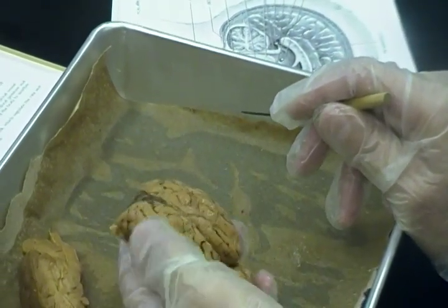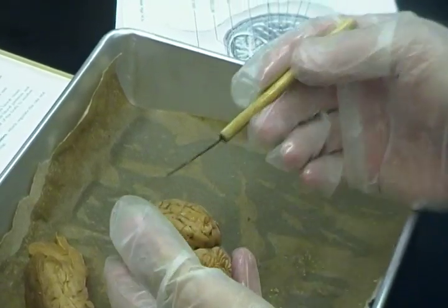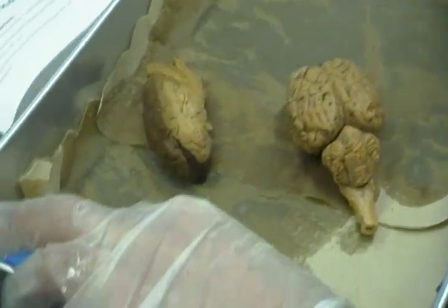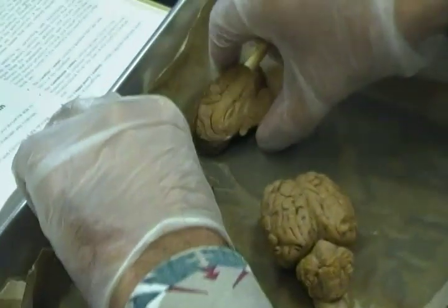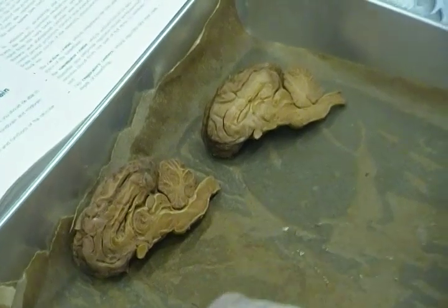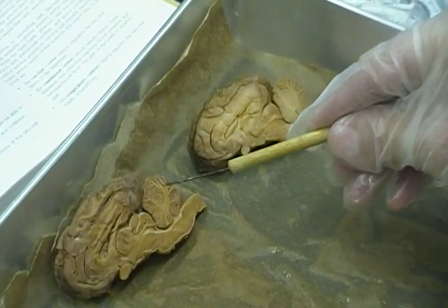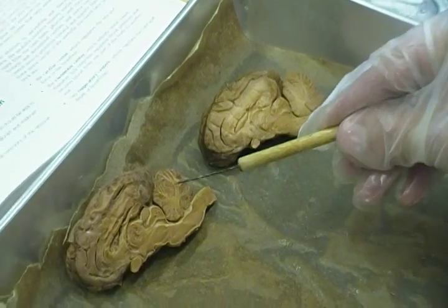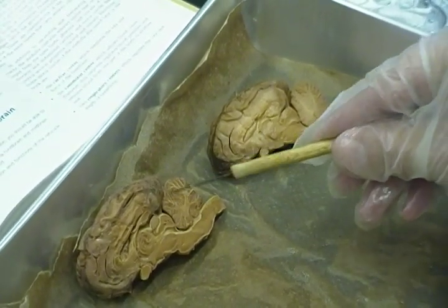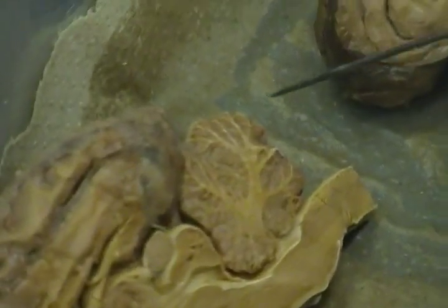What else can we tell on this little brain? That's about it. That's all we can really tell on the whole section. We look at a half section, sagittal section, and there's a lot more that we can see here. We can see these white fibers, these white threads. Arborvitae, exactly. So then this structure has to be who? Cerebellum. That's got to be the cerebellum.